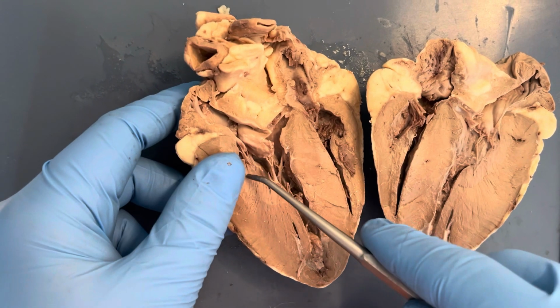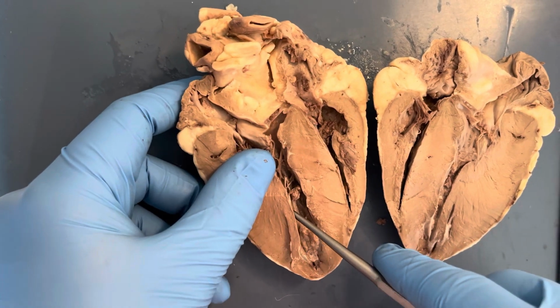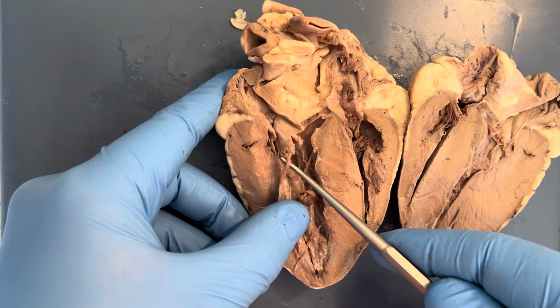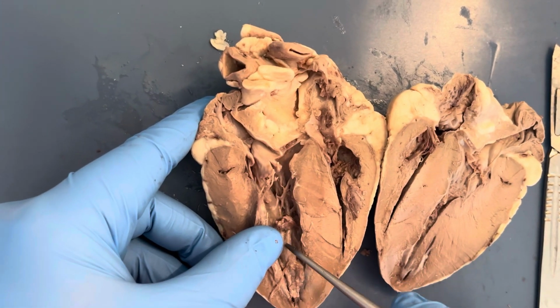The right ventricle receives deoxygenated blood from the atrium and contains muscular myocardium that pumps the deoxygenated blood through the pulmonary circuit. The trabeculae carneae are the muscles in the ventricles that form branches that produce strong contractile force with each contraction of the ventricle.